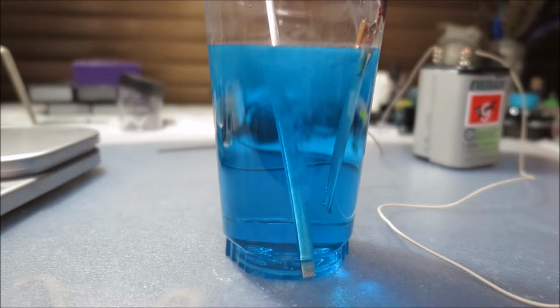But I hurriedly sanded it down to expose the true color, and then I used carbon, as in pencil leads, but that too dissolved into the water and corroded, so I had to use a tissue and remove the floating carbon shrapnels.